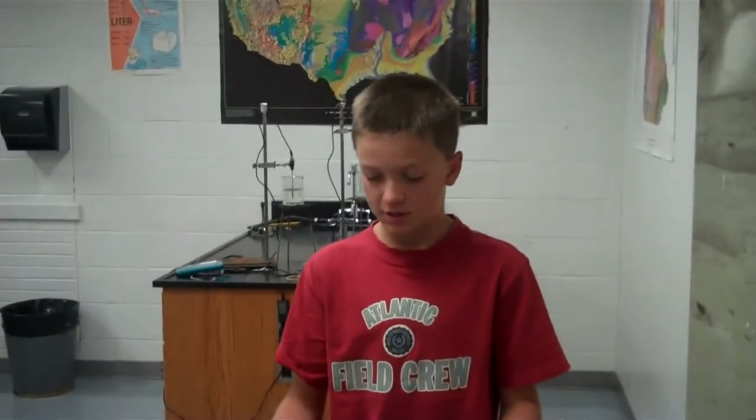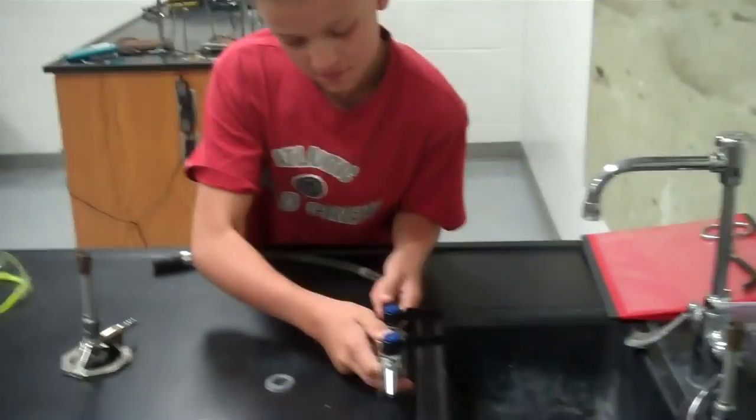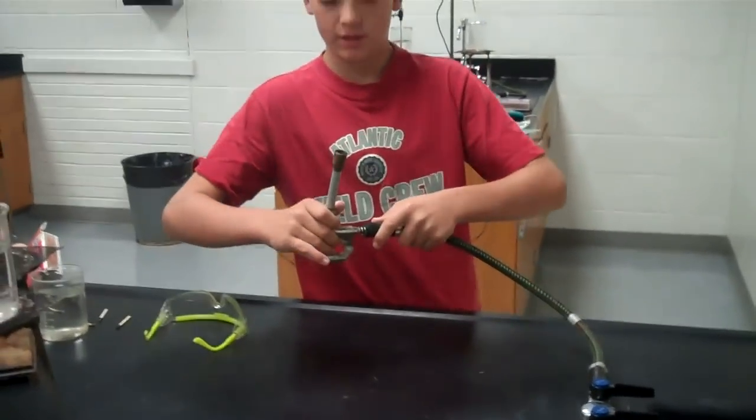I'm going to tell you how to use a Bunsen burner. Take the hose and plug it into the gas. Then you take the other end of the hose and plug it into the Bunsen burner.